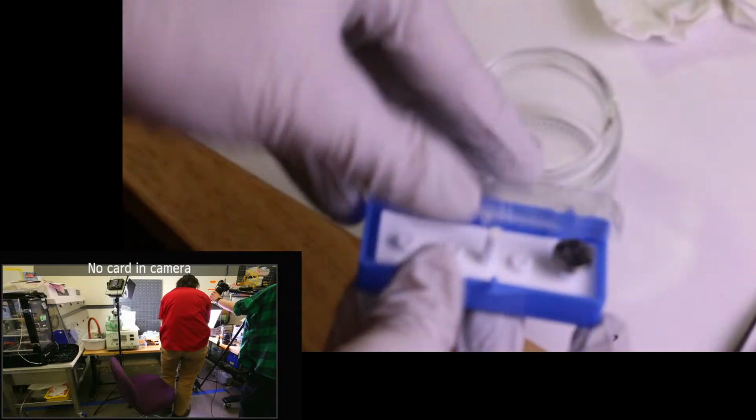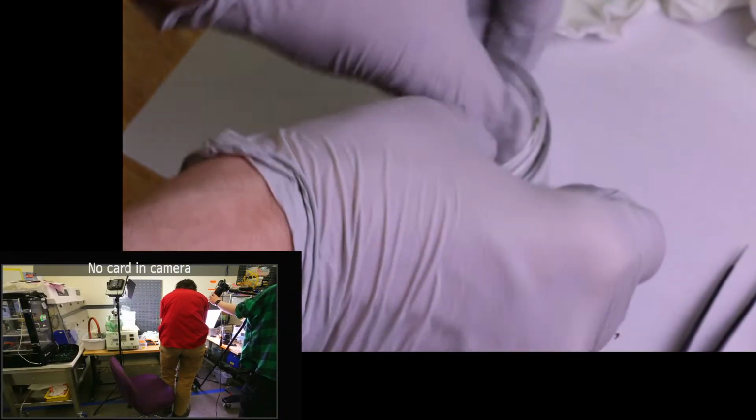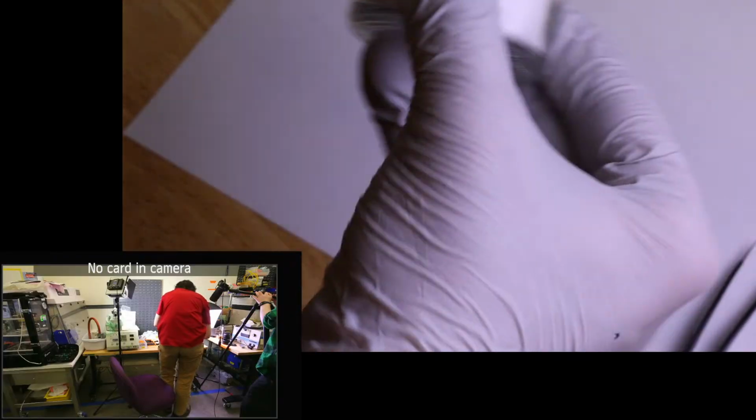So I'm going to go ahead and put the rest of this back in the jar, kind of in the order I removed it. We'll throw this in, we'll throw that in our case for now. So that's our prepared sample. We'll fold that one back up. And let's put these back in. Okay, so that's our sample preparation.